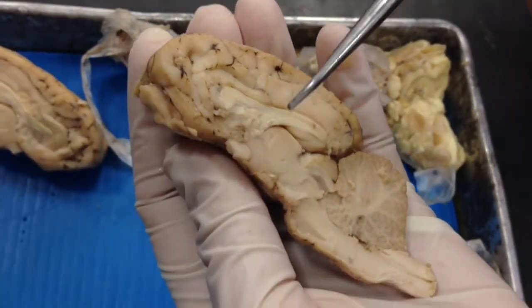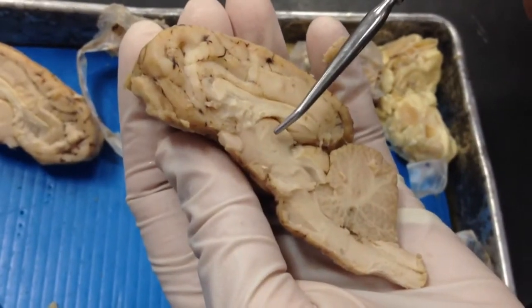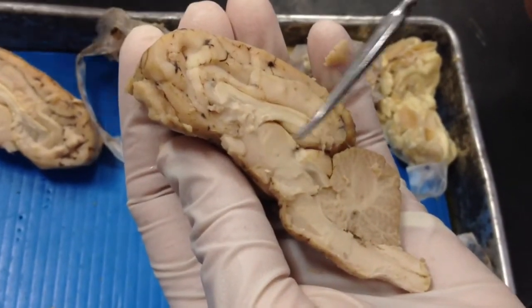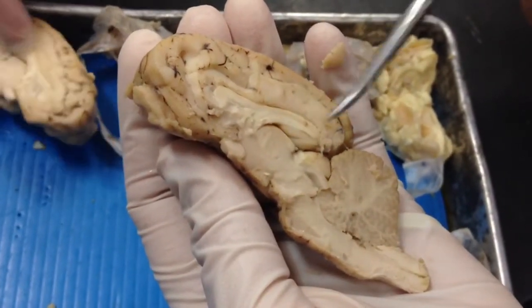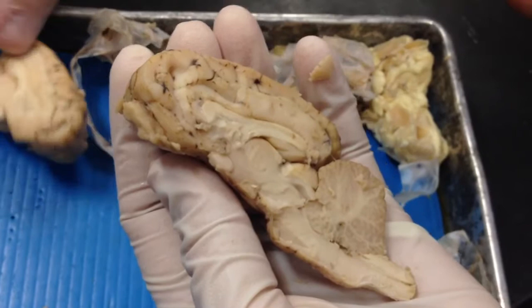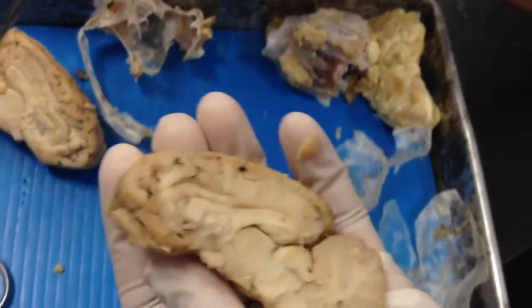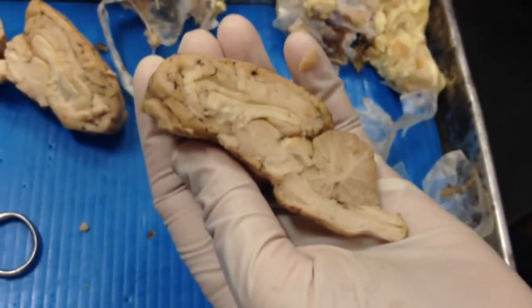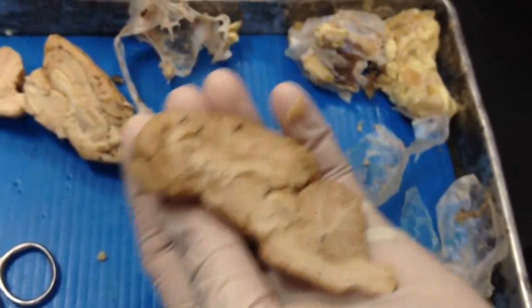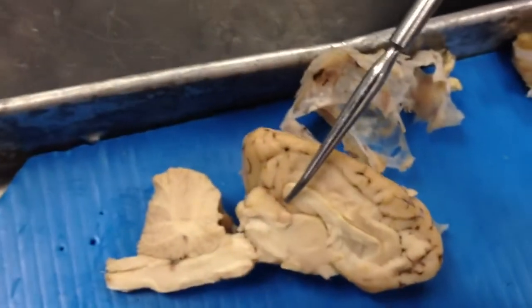The interthalamic adhesion — it's in the middle and it connects the two oval egg shapes together. That little dot — actually, I think this one's the pineal gland. Yes, that's the pineal gland.